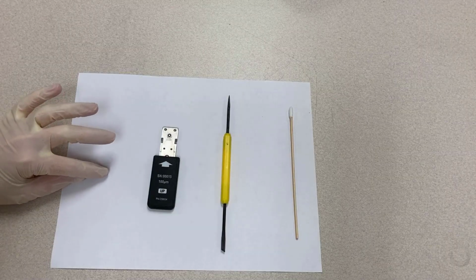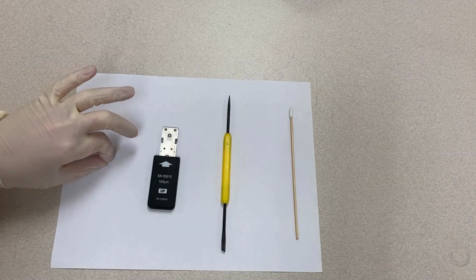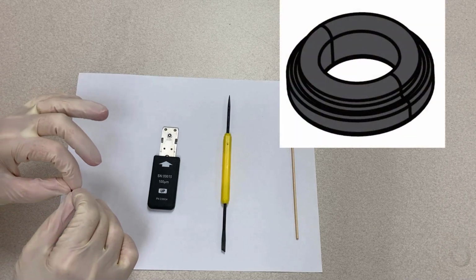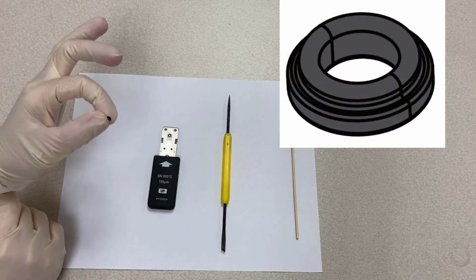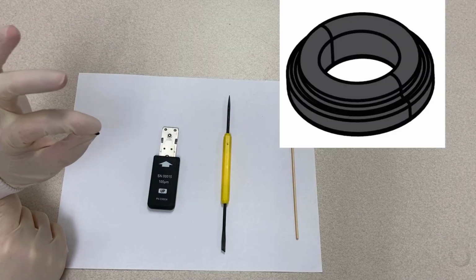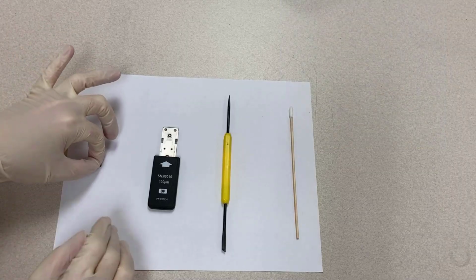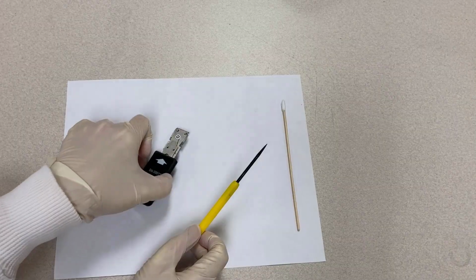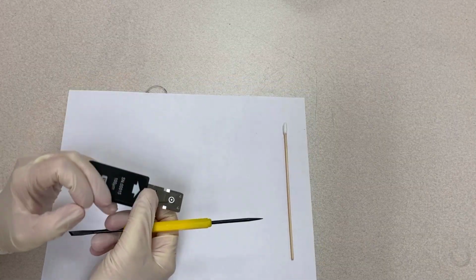The following is the O-ring. The O-ring, 1, of the nozzle module is replaceable if the O-ring is damaged. It is recommended to replace the O-ring every month. Note: 10 spare O-rings are supplied in the CytoFLEX SRT accessory box. Pull out the O-ring from the nozzle using pointed tweezers or a pin.